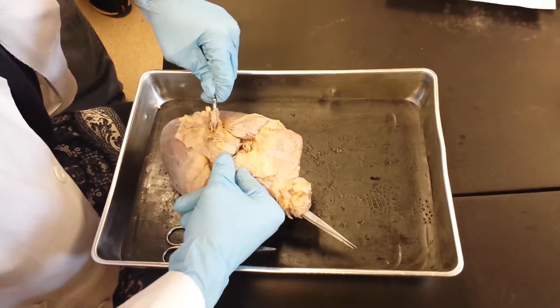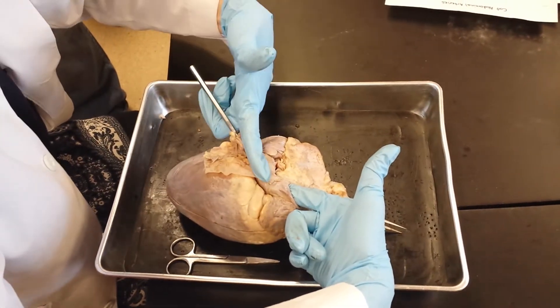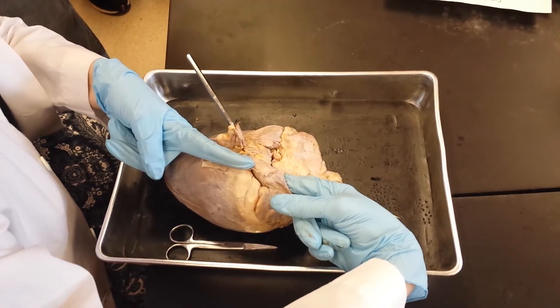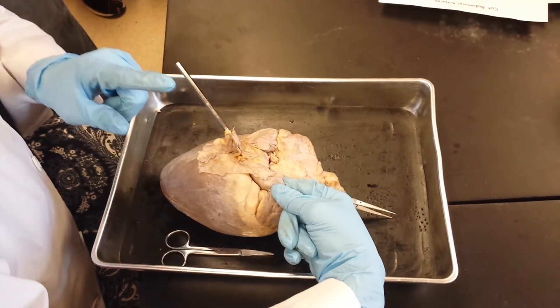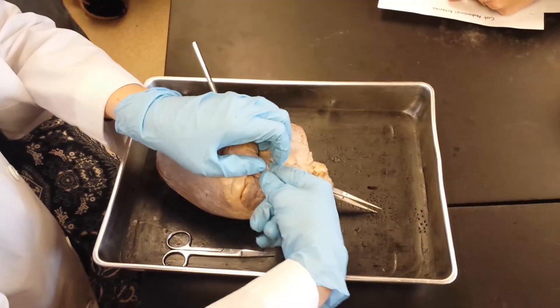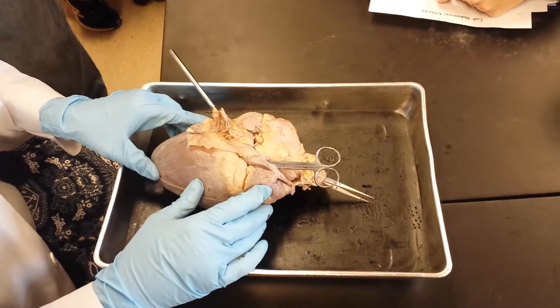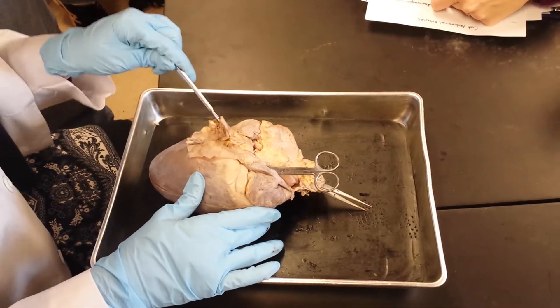What I'm going to do when I pin this is — now you can see I'm actually touching the probe inside here. This is the inferior vena cava coming up, and this is the superior vena cava. They both dump into the right atrium. Unlike in the human where they come in at about 180 degrees, this one's at a slightly different angle. When I pin it, I try to pin it as obviously as I can — I would stick a pin out of the superior vena cava straight up and a pin out of the inferior vena cava. So when you see those on the right side you can identify the superior and inferior vena cava even though you can't touch it yourself.